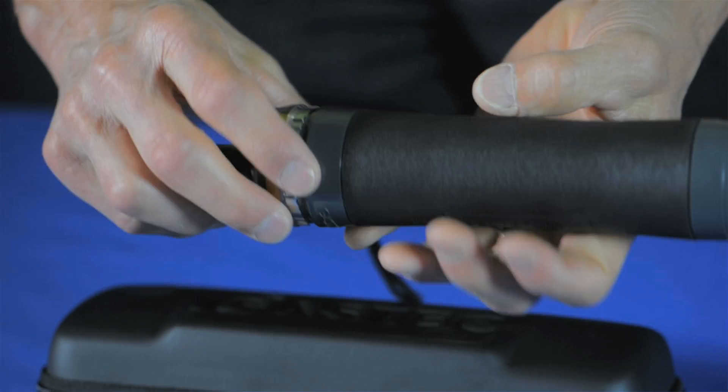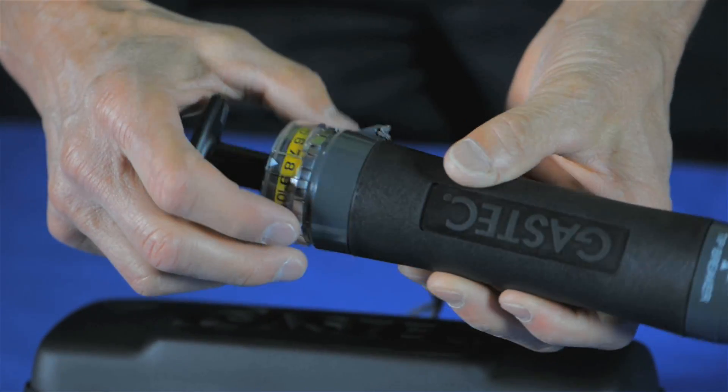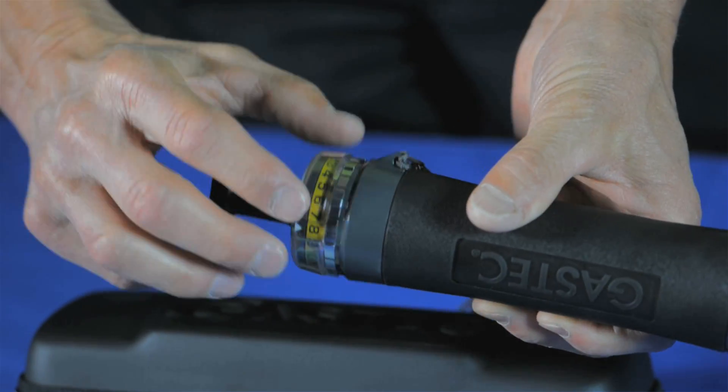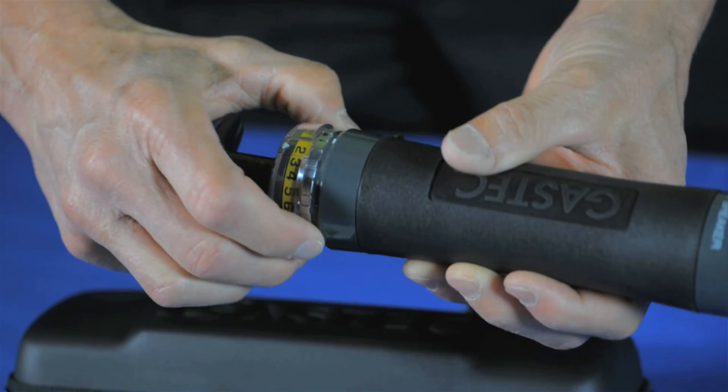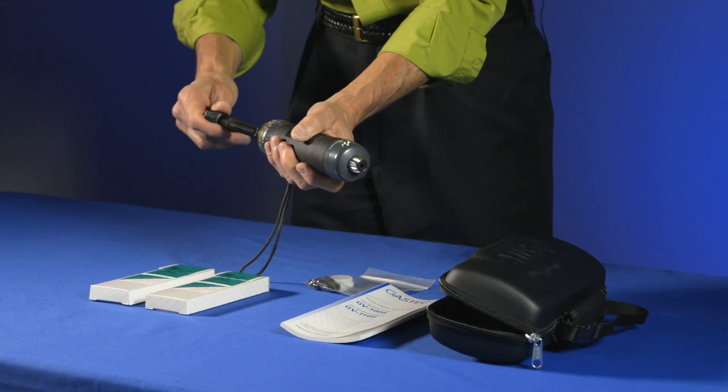The pump itself has a stroke counter at the end of it. So when we use multiple pump strokes it will advance and keep track of the number of pump strokes that we've taken.